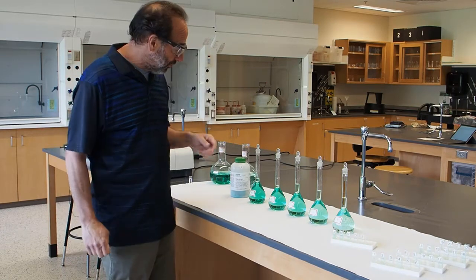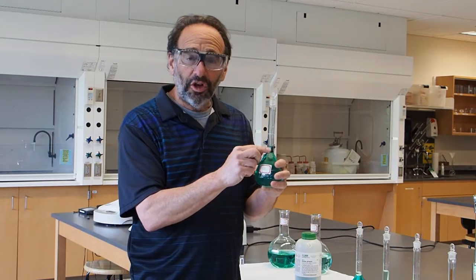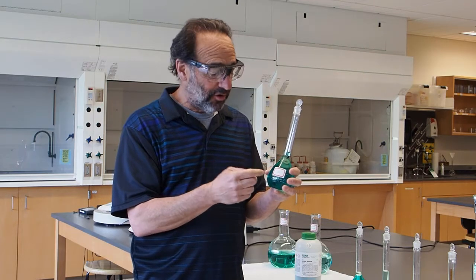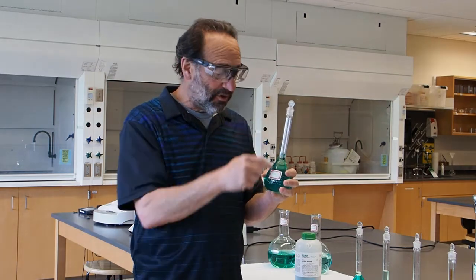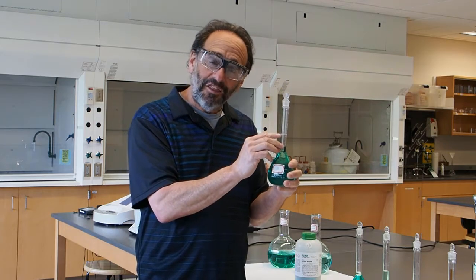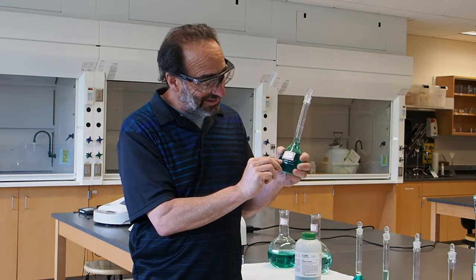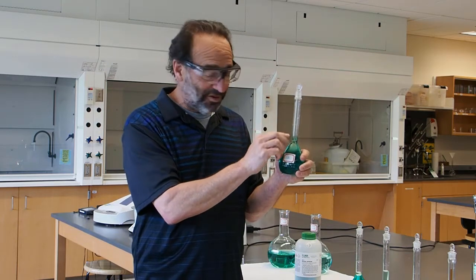To do that, we use volumetric flasks. A volumetric flask is a flask that holds a certain known amount of solution. We weigh out our nickel nitrate, dissolve it in a beaker with some water, pour it in, and rinse the beaker into the flask. Then you fill it up with water to the line, and it holds exactly the amount it says — 250 milliliters. If you ever use one of these, it has a little TC marker on there, which means 'to contain.'